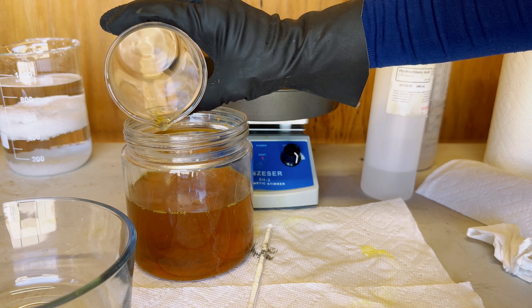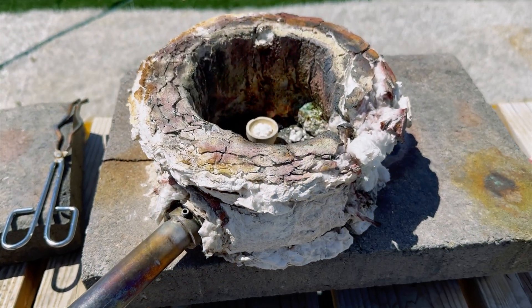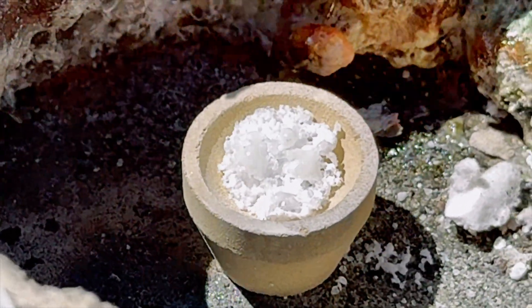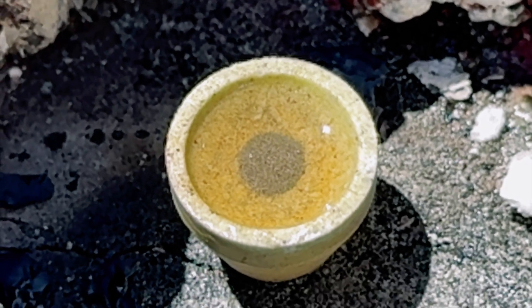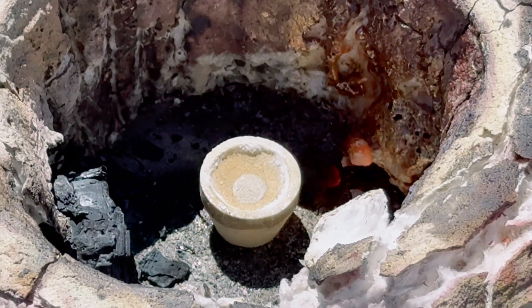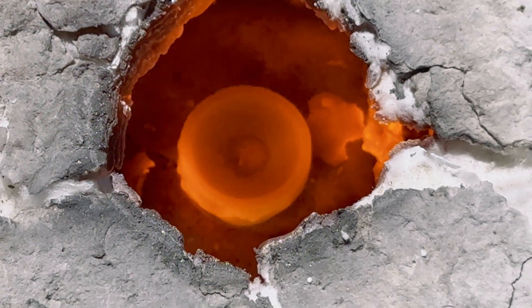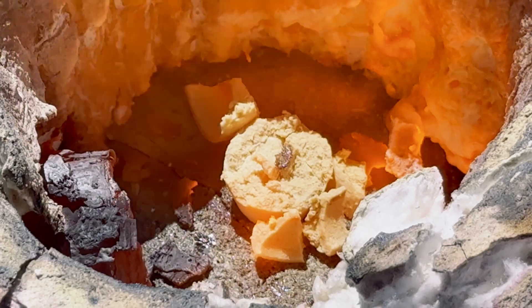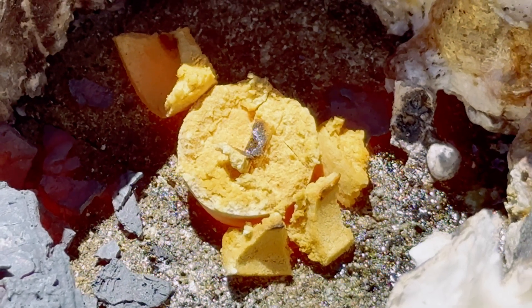There is really next to nothing in our beaker, but we're going to press forward and find out what that material is. I am going to glaze my 15-gram cupel with some borax and see if it will work for the gold drop that we have. We have our material in our cupel — now let's see what we have. I went to pick up the cupel with some tongs and it just crumbled to pieces. I did let this heat in the furnace at 2100 degrees for five minutes and it stayed black, so it is not gold.